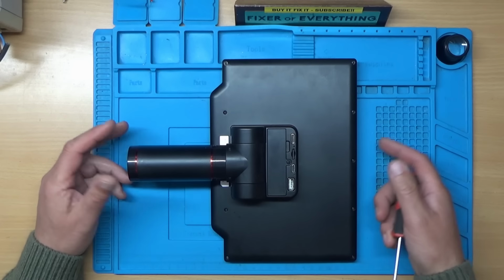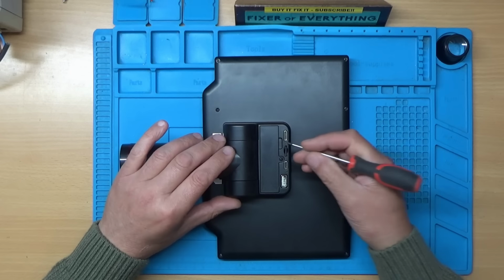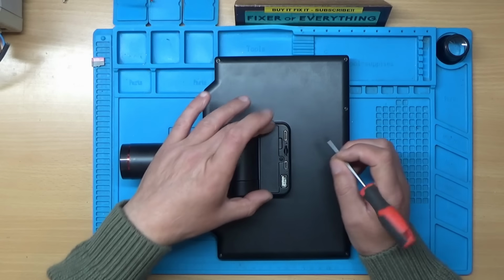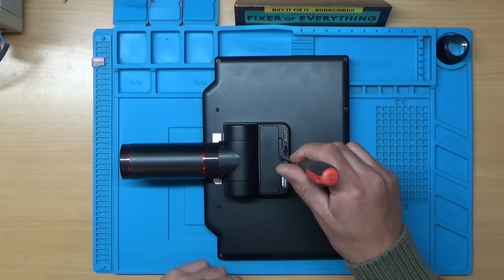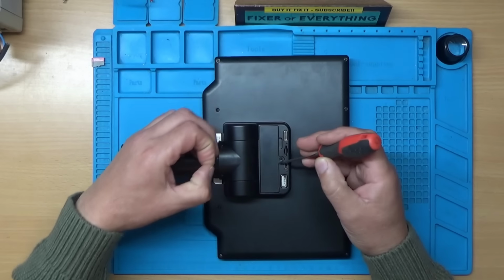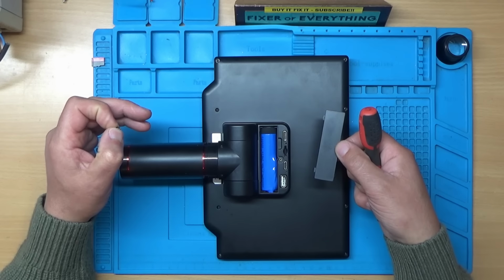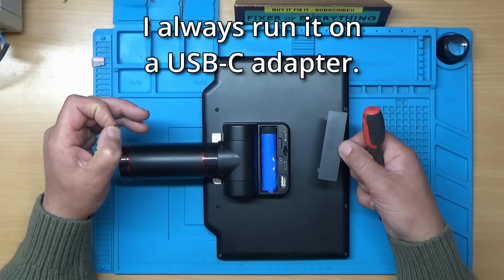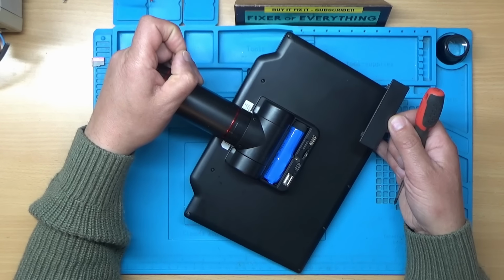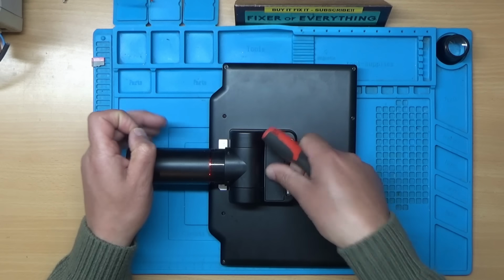Right, I've got it off the stand. I really like this microscope. It's actually really good. I'll just pop the SD card out here. And I've just noticed it looks like there's a socket or a cover on the back here. It looks like for an 18650, so it's that sort of size. So I wonder if I can add a battery backup. Actually, yeah, it's got the 18650 in already. 2000 milliamp hours. I always use it plugged in, so I don't really use it on the battery.